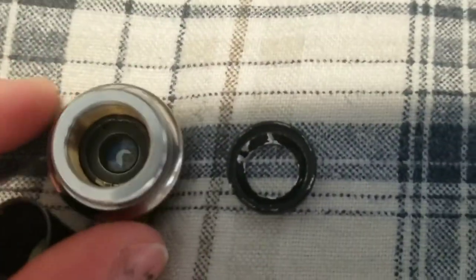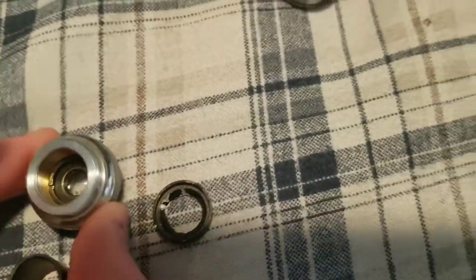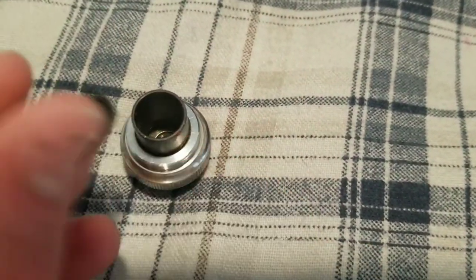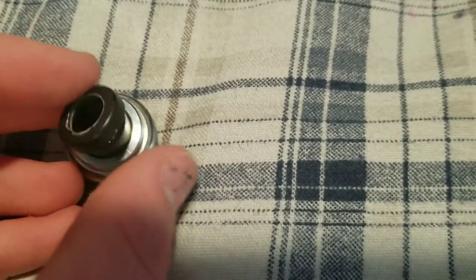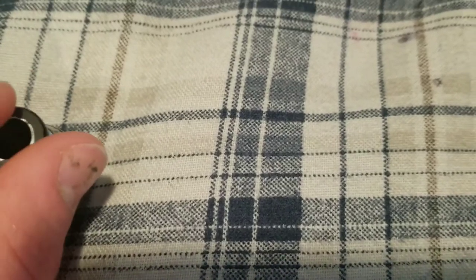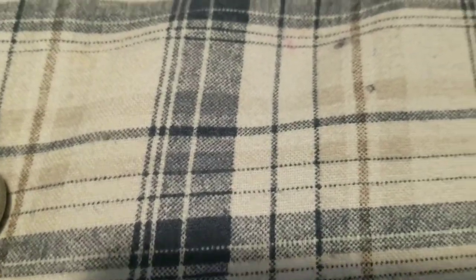I also made a few other mods to the microscope. I took this 4x lens. It has this brass coating, which makes it reflect light and makes the picture a little blurry because of all the light beams bouncing off. So what I did is I took some black pieces from the microscope that I took apart and stuff that aren't in use in the microscope, and I used them to build a sort of blind so that there's not so much scattered beams of light in the 4x lens, and I'm going to make similar modifications to the microscope just to improve it slightly over time.